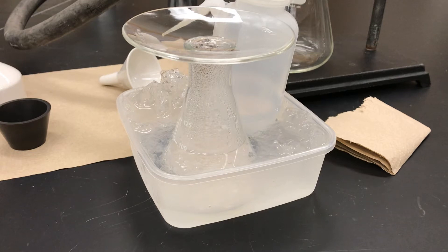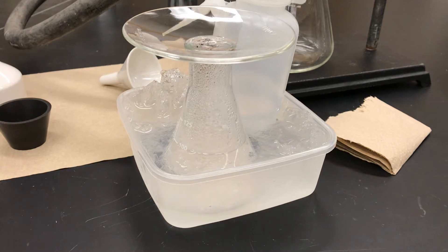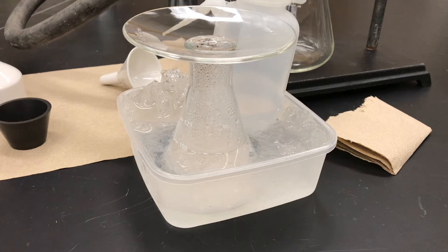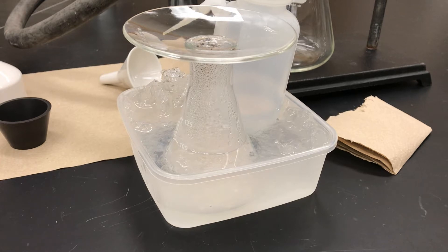This video is going to introduce suction filtration, which is something you might use after a crystallization. If you have a situation where you've got a solid in a liquid and you want to isolate the solid, then that's where you would use this technique.